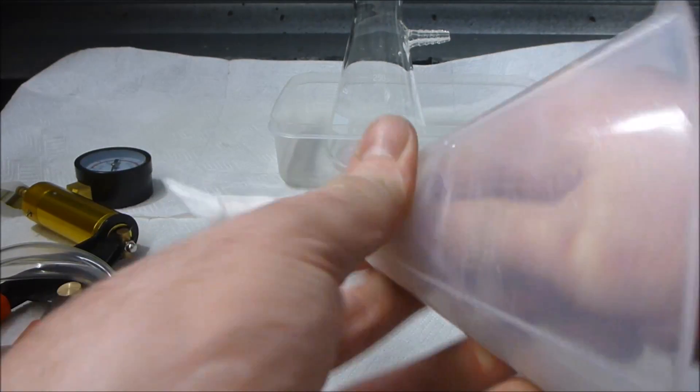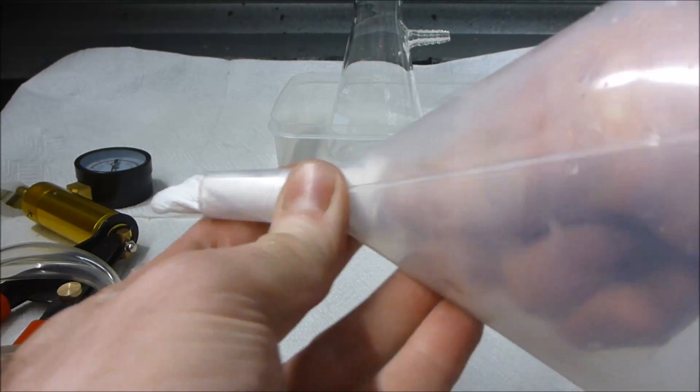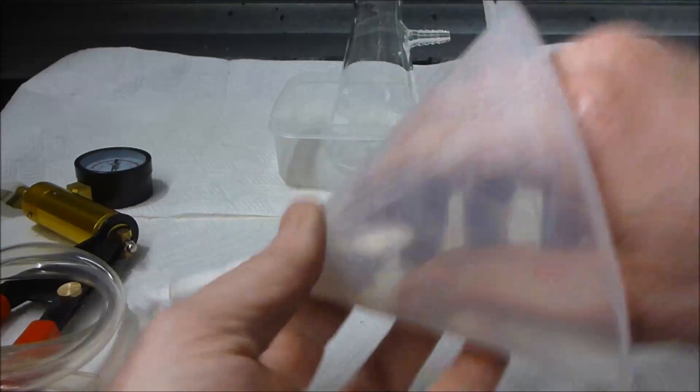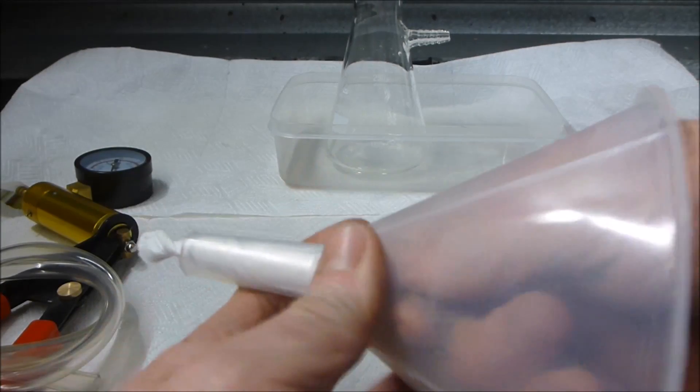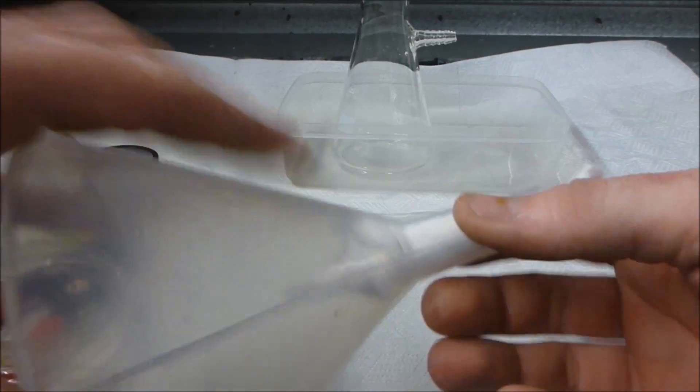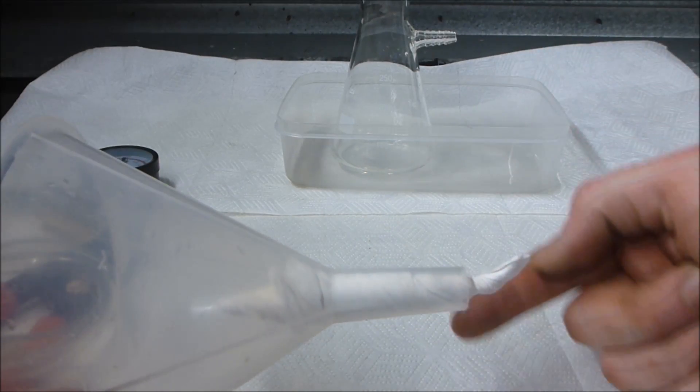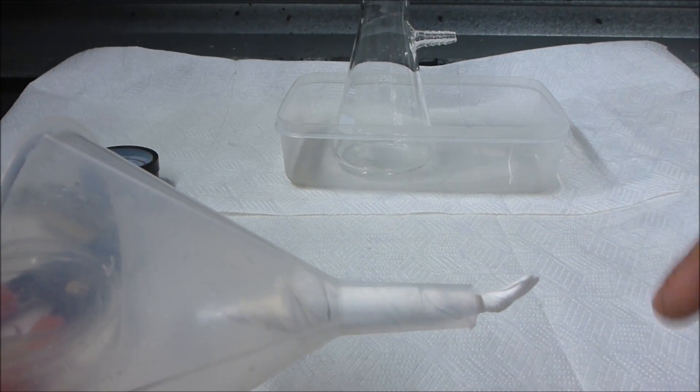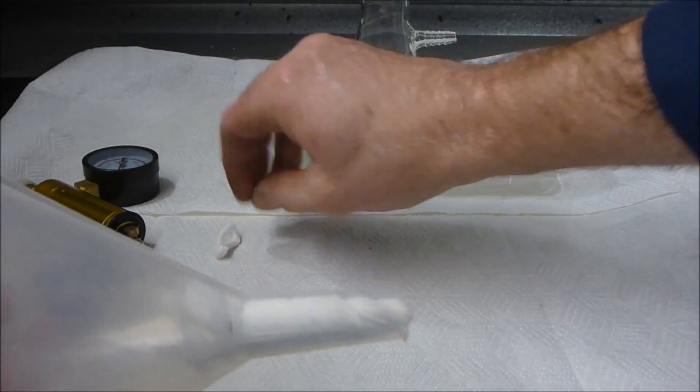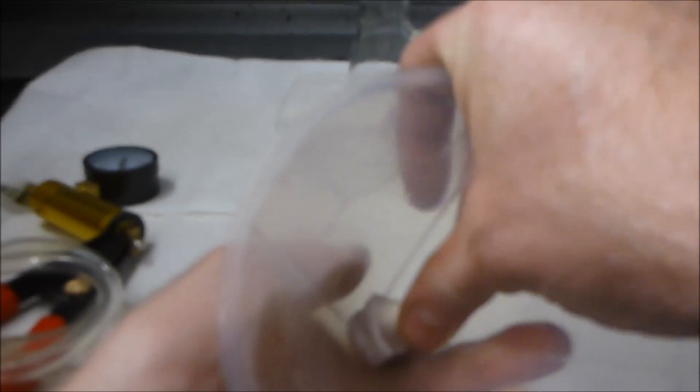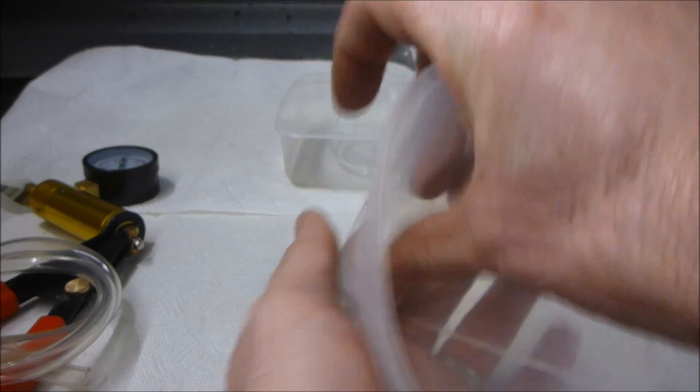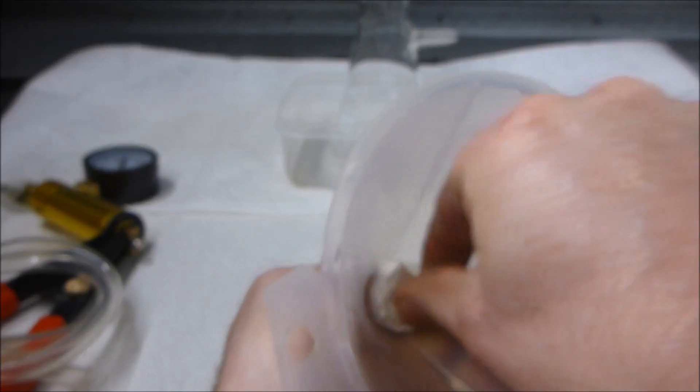You can see I'm basically squeezing that as well as rotating it. Get as much of it into the funnel as we can. The tighter you can make this fit in there, the better the whole system is going to work. You want to avoid having your spiral too loose. Use scissors and chop off any excess, then squish it with your fingers to get it really tight into that neck of the funnel.